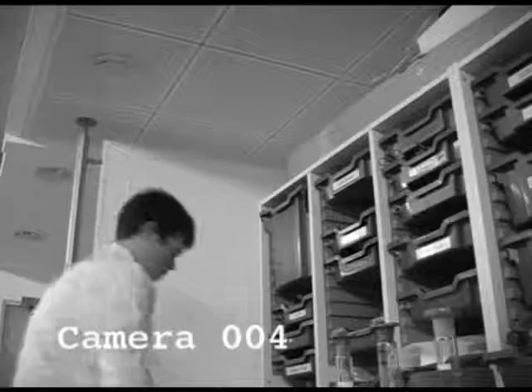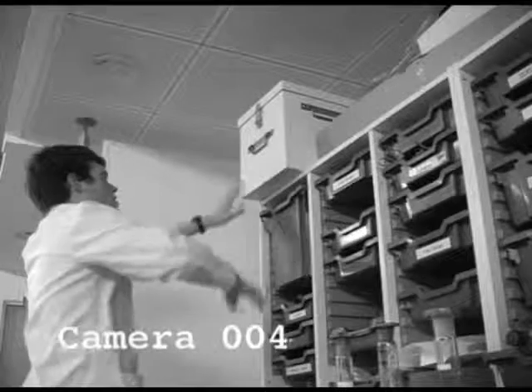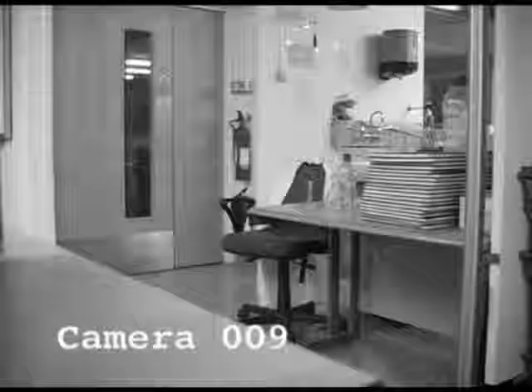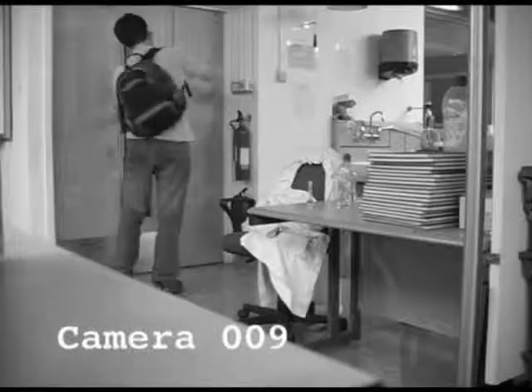Now, let's see you just putting something heavy on top of the shelf. Yep, there was light, there was nothing in there. Nothing except for some jars of toluene. Some large containers of solvent on top of a shelf. Do you call that safe? It wouldn't have fallen on anyone. And you're absolutely convinced of that, are you? Well, to be honest, not really. Well, at least you turned the lights off on the way out.